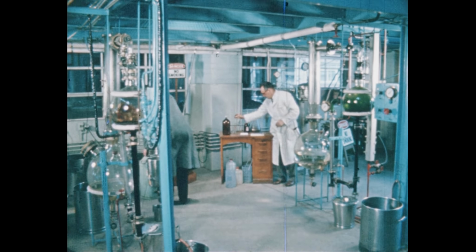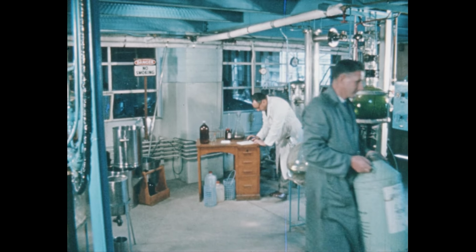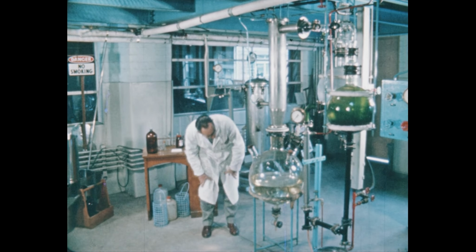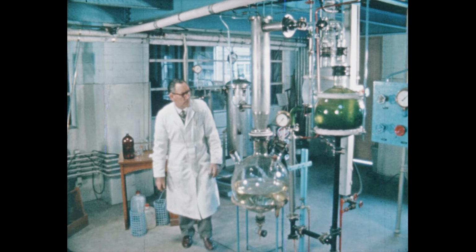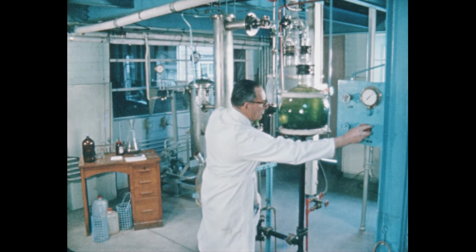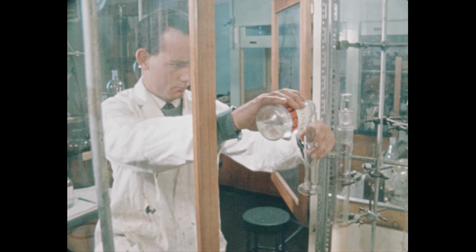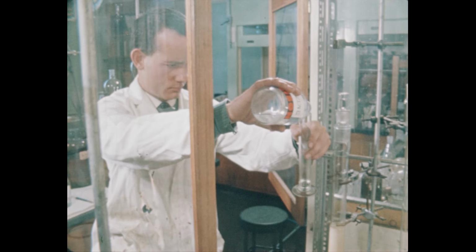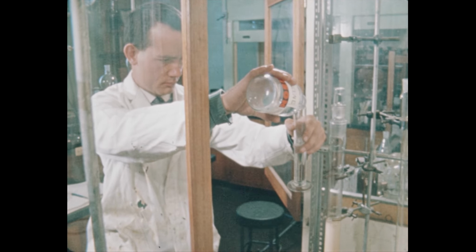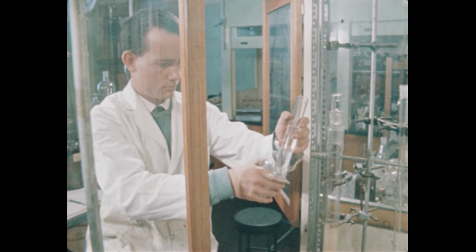Although your day-to-day using benzene may tend to be routine, don't let familiarity lull you into carelessness. At each stage of an experiment, use safe working practices. The toxic effects of benzene can be avoided with certainty only by observing the simple rule, avoid breathing vapors. If another less dangerous solvent cannot be used instead of benzene, then begin and end the work in hand here, in the fume cupboard.